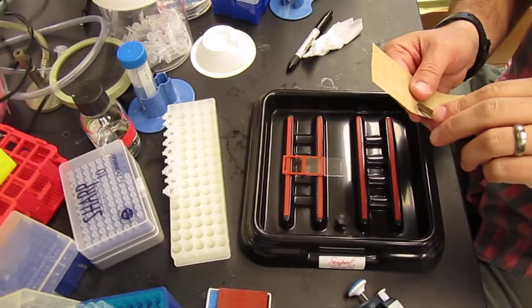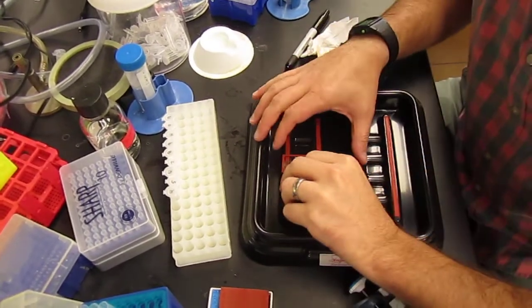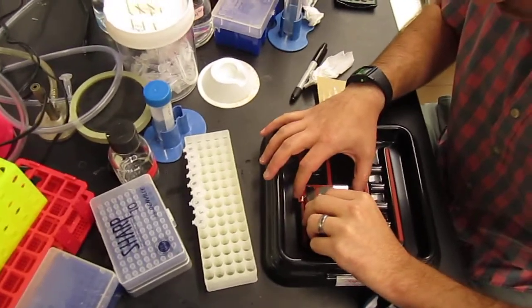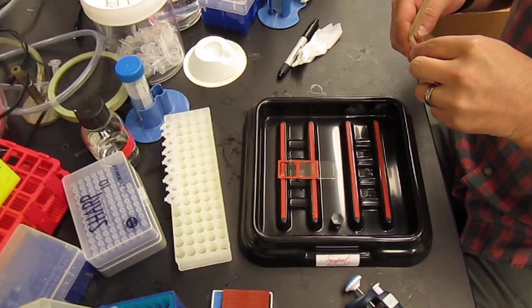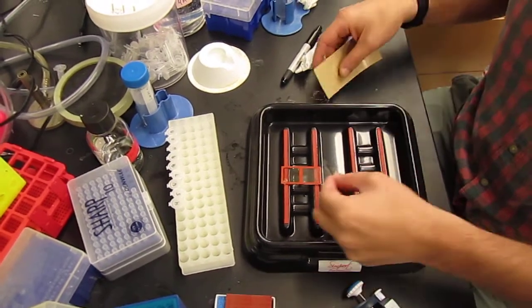There are seals for each of the ports. Place on one. Place on the other on top of each of the ports.